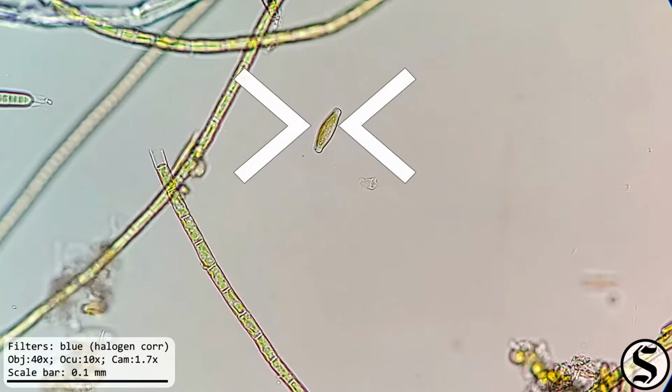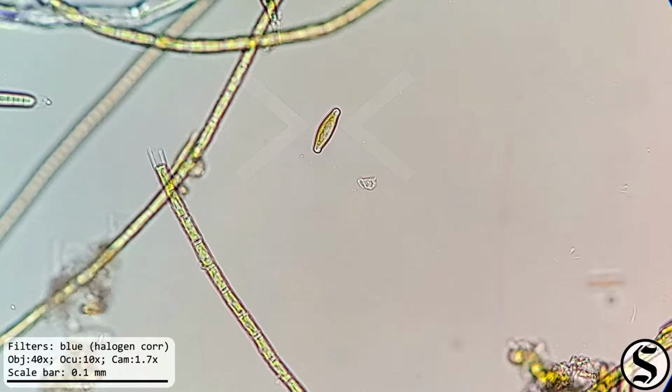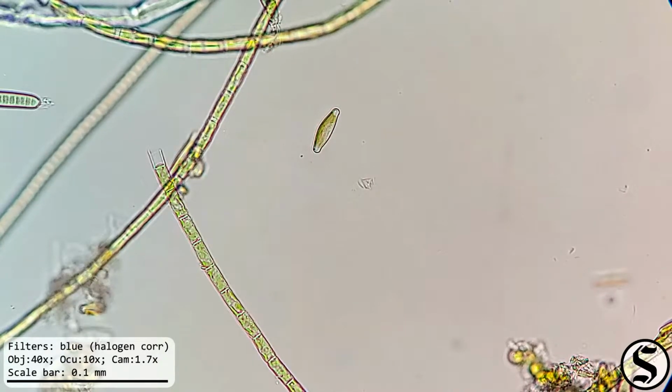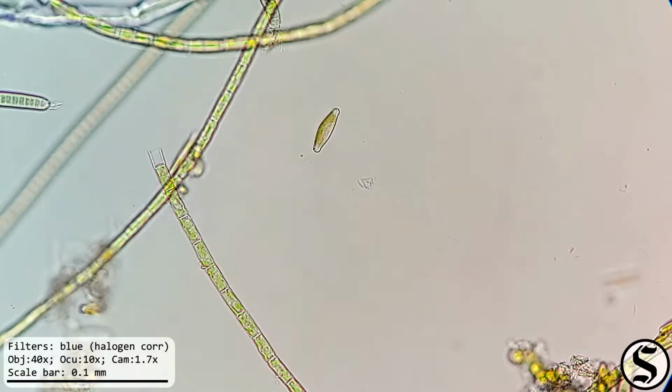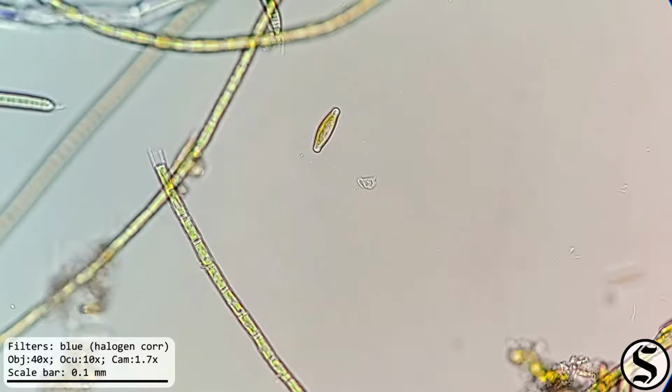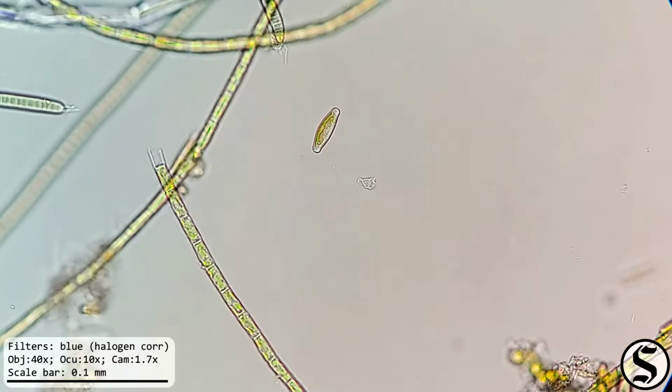And there's another diatom. Diatoms are of the class Bacillariophyceae. That comes from the Latin bacillus for little staff, and the Greek phykos for seaweed.